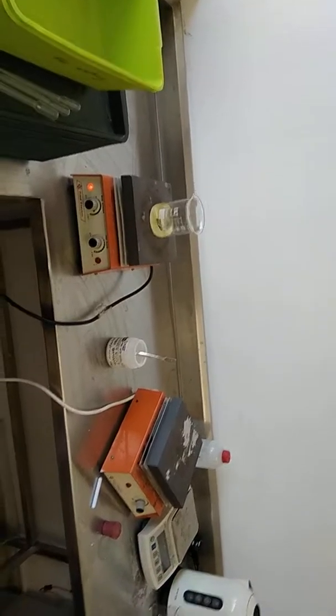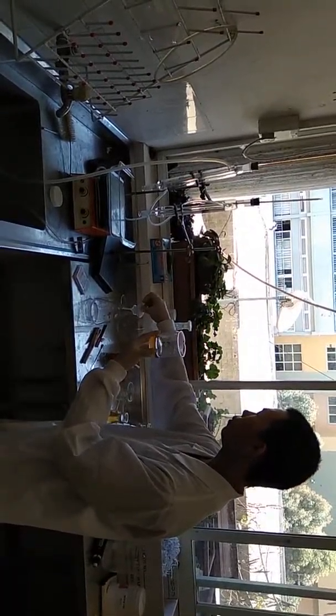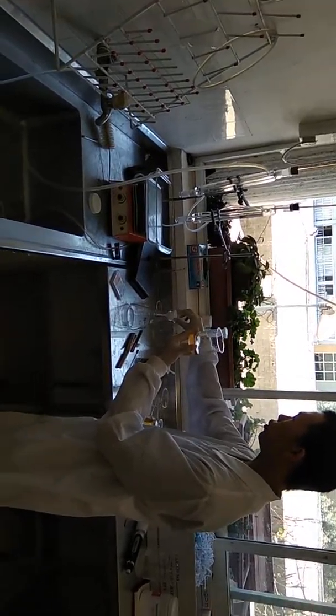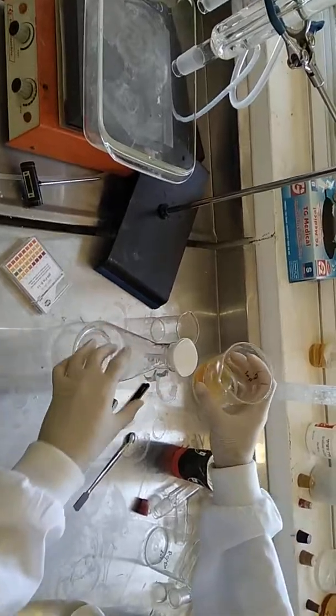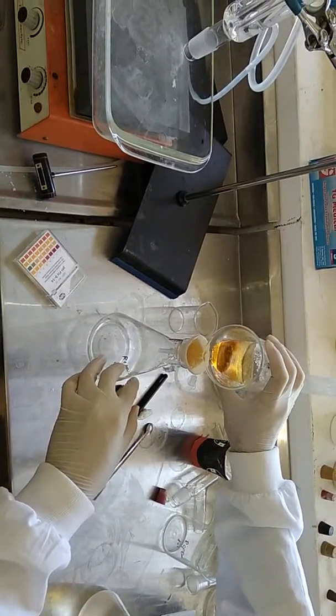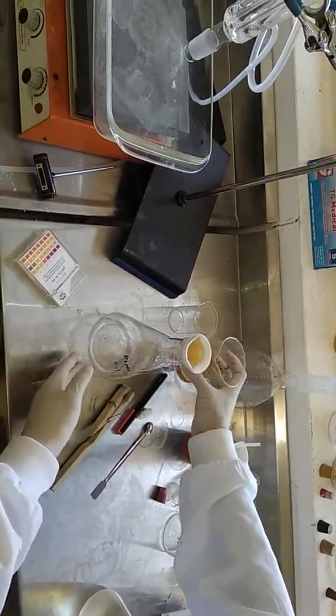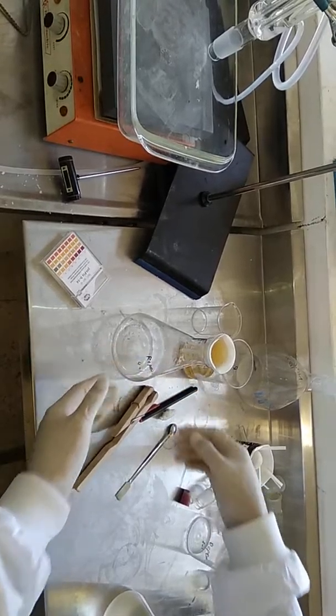And can we move a little bit here? Yeah. Okay. And after that, I got the ester here, but not yet pure. I need to use the filter to take off the solid, which is still included in the solution. I take the filter like this and put it in, so that the thing I got here is pure ester, 100% ester.